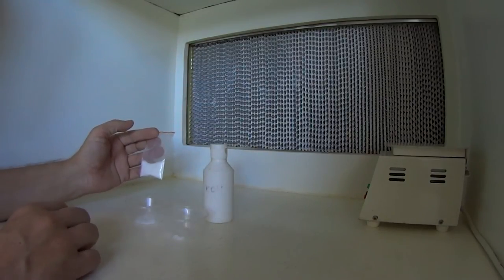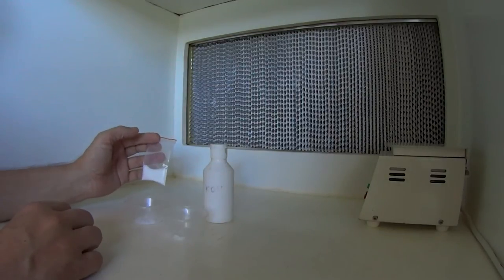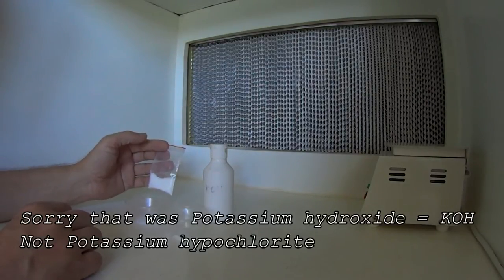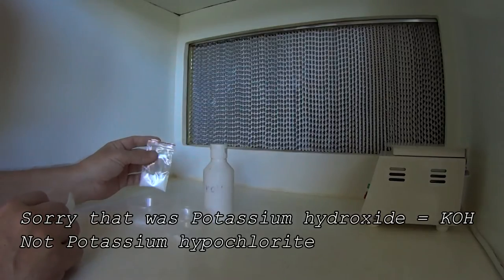I've got a base here which is potassium hydroxide. It is a reasonably nasty chemical, you've got to be careful. I'd recommend wearing safety glasses when dissolving it.